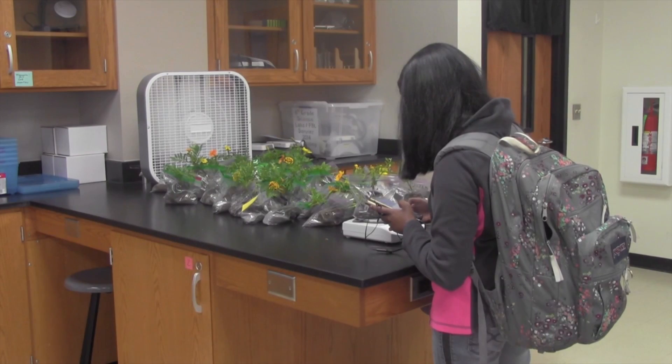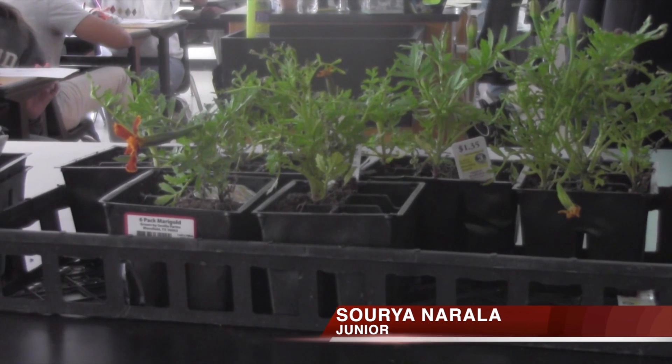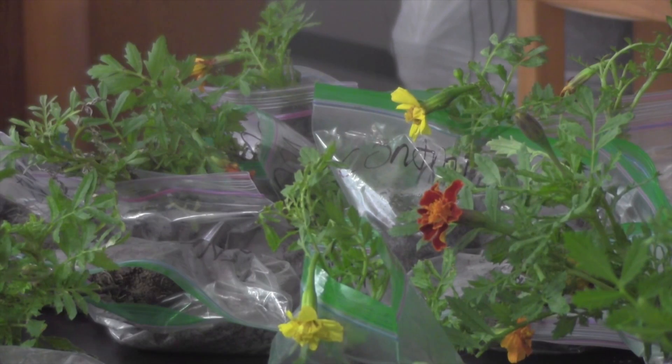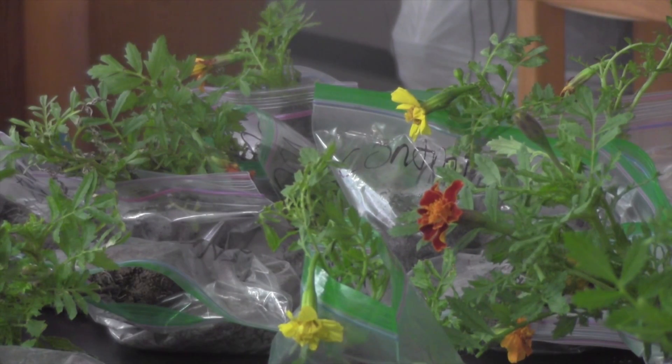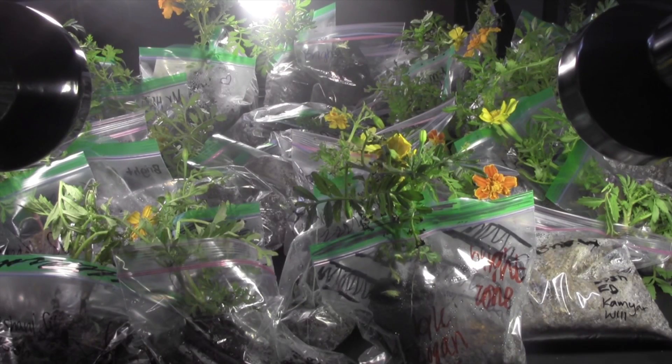Not only is this lab interactive, it can also help students for the future. This lab provides a basis and background information about plants. I could definitely use that in college if I'm going down a bio major. And even on the AP test, if I forget something about plants, I can always relate back to this experiment.